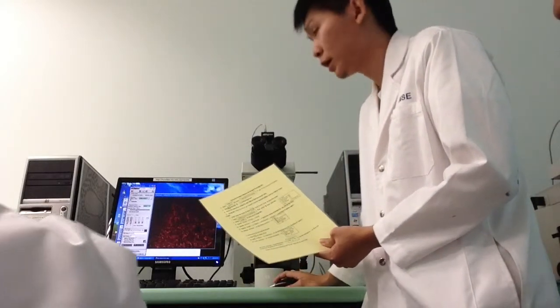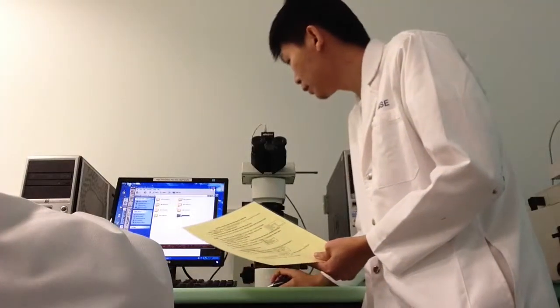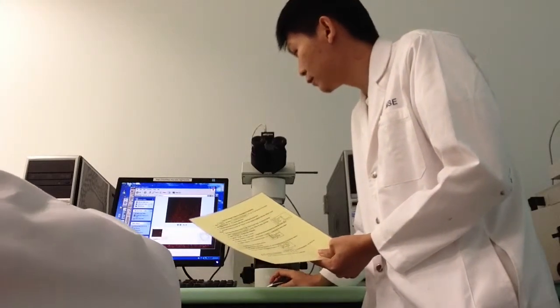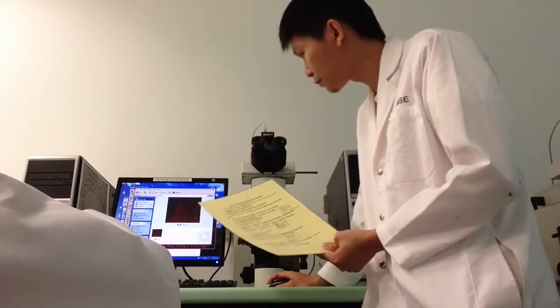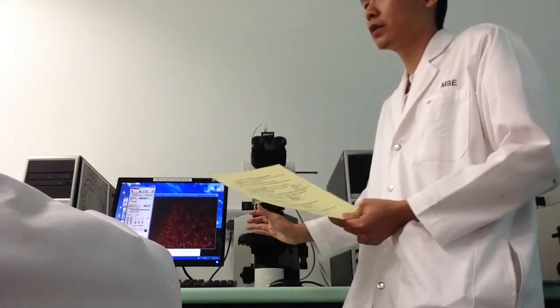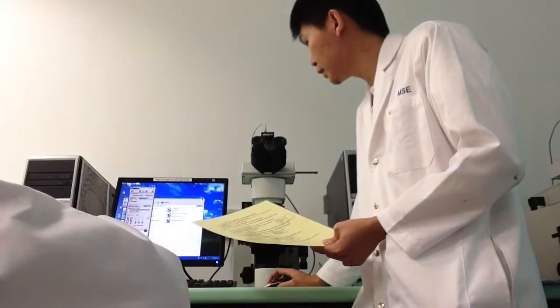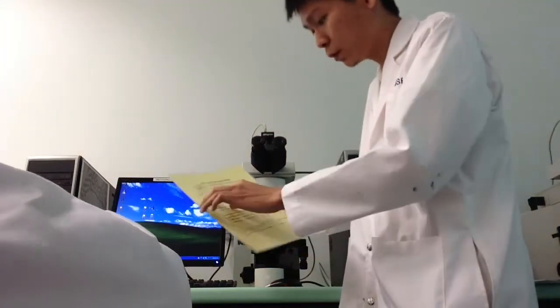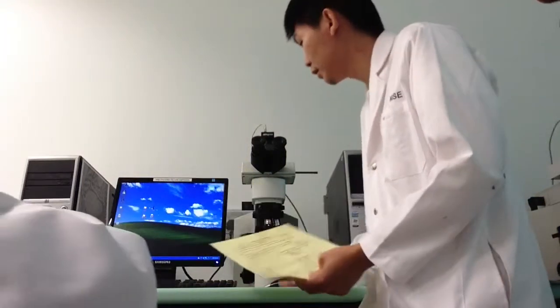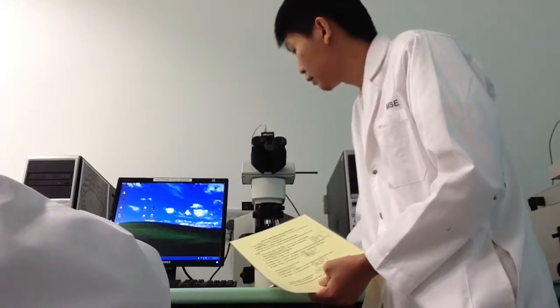Grab frame. When you go back to your folder, you should see an image file. So that's all for the microstructure camera, because it's just to grab frame. So you just close this, and you open up your ImageJ. ImageJ is somewhere on the desktop already, so you just double click.